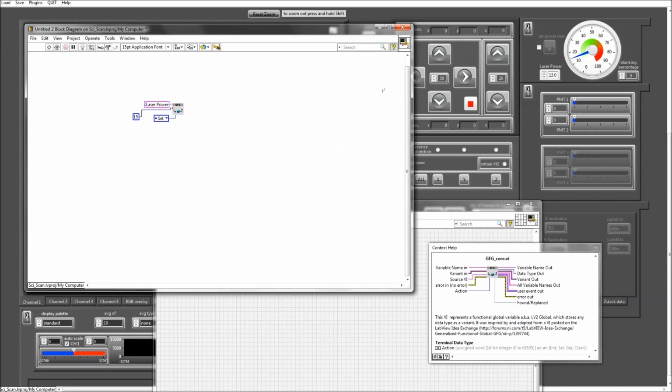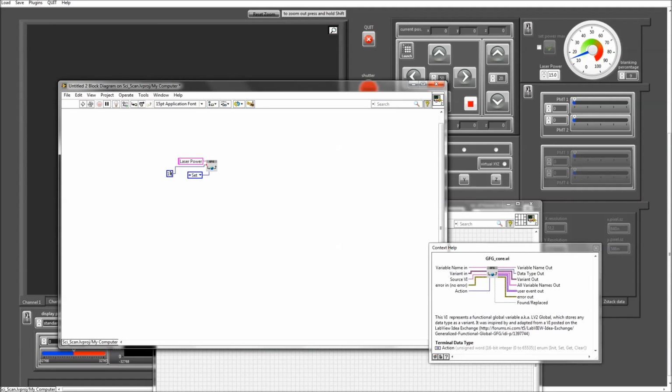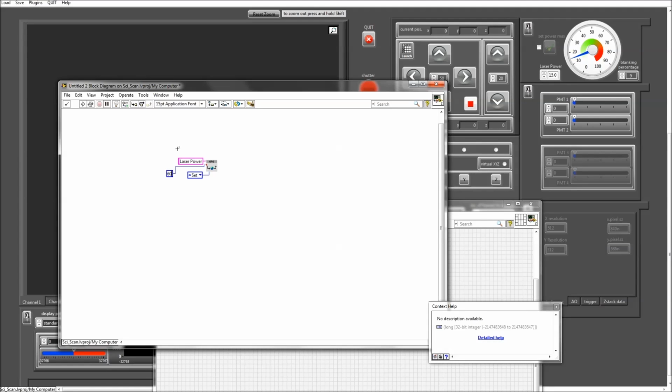And you can see on the main SciScan user interface, the value gets updated. I can do that again, show you that with a different value. You'll see that the value gets updated when I change the setting from an external VI.